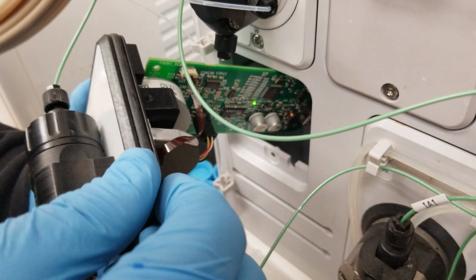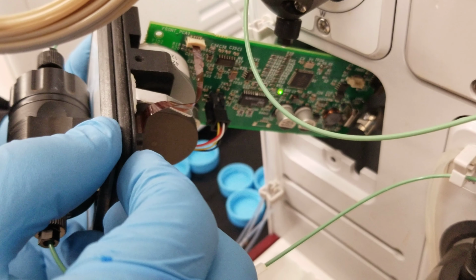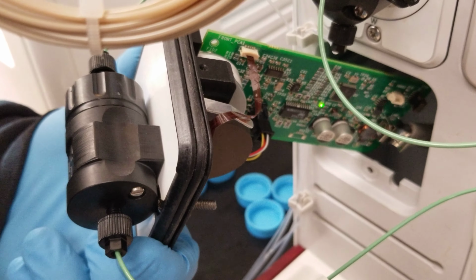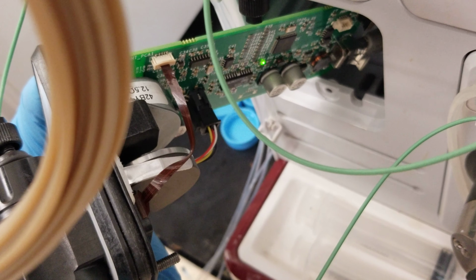Yeah, you can see it. You don't need to zoom in. I can do this, but you can easily see it. Just move your fingers. Sorry. Does that help? So if it's spinning, as you can see.